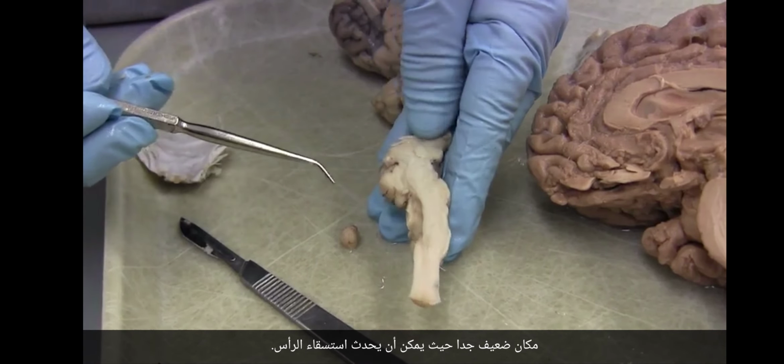Okay, so now we're going to look at the ventricular system. And we really didn't emphasize this in the course, but inside of the brain there are these spaces that contain cerebrospinal fluid, or CSF, and they are within the telencephalon. There's a piece of ventricle in every section. So within the telencephalon, it's called these lateral ventricles. That's this C shape. And then in the diencephalon, it's the third ventricle. In the midbrain, it's the cerebral aqueduct. In the hindbrain, it's the fourth ventricle.